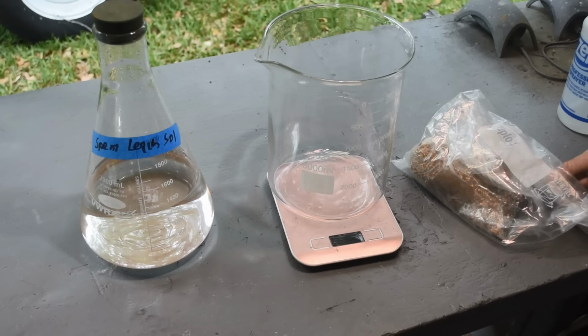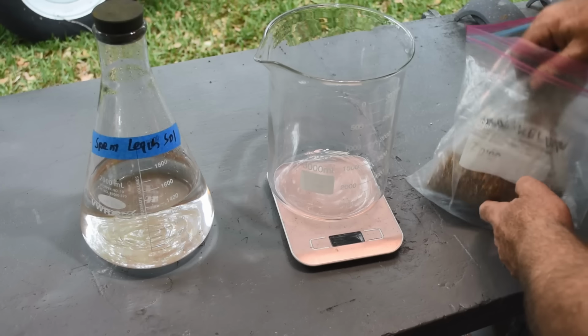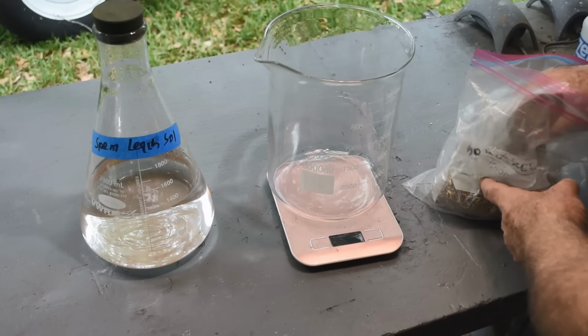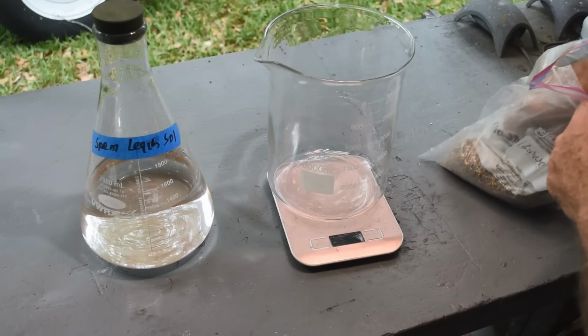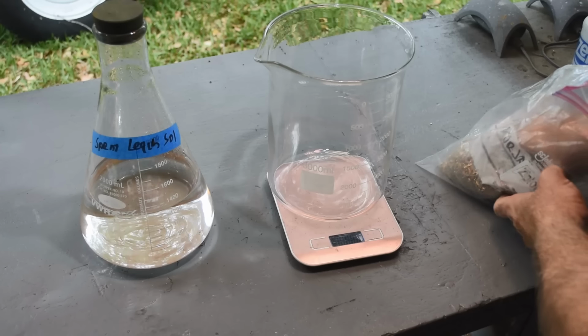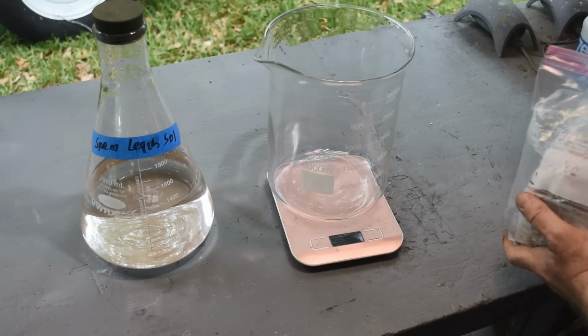So every time I've done this, I've done 300 grams. It's just a benchmark, a baseline. So I'm going to weigh out 300 grams of these pins again. And we'll try it again. We're going to do things a little different this time, though.